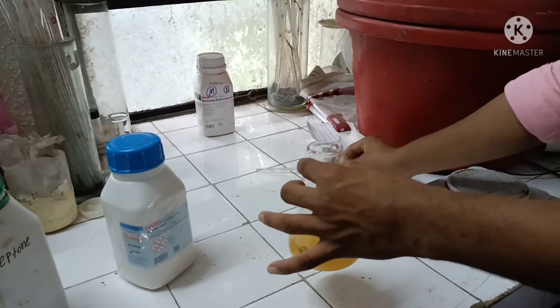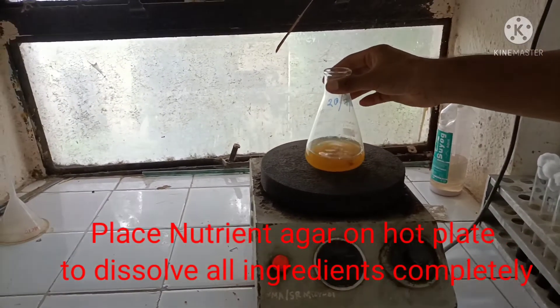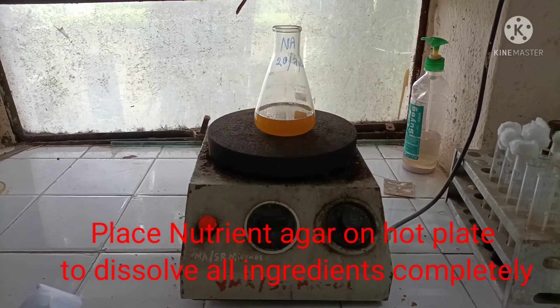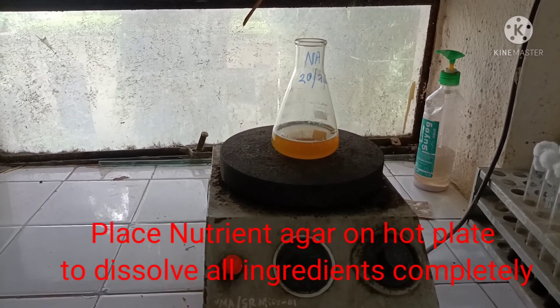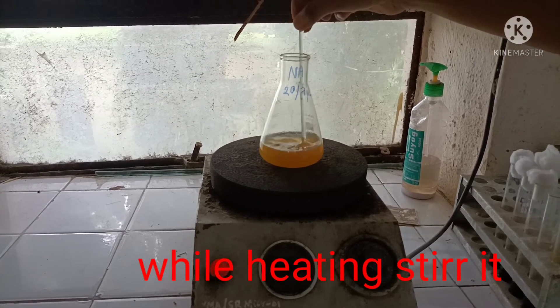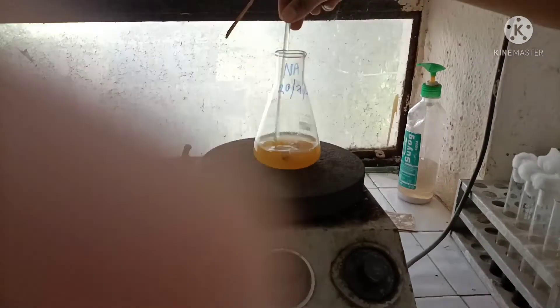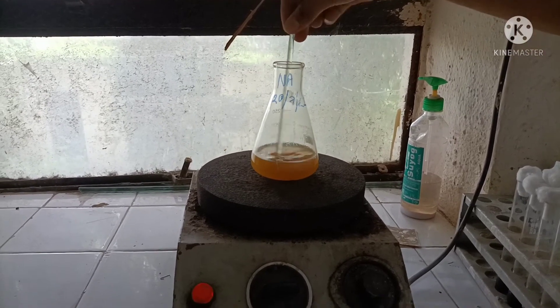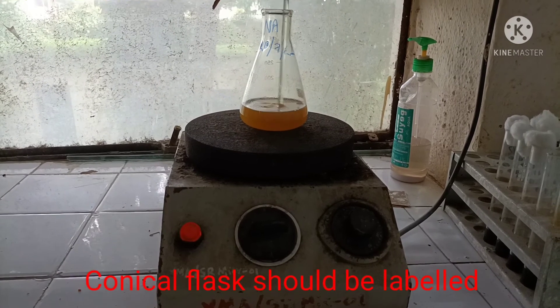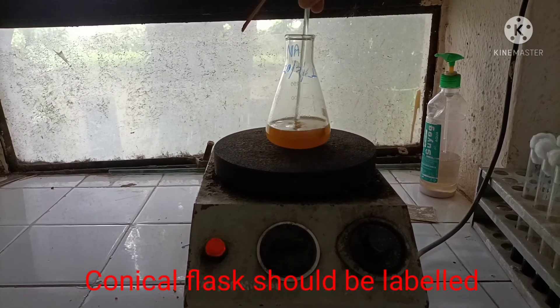Then we place the conical flask onto the hot plate for heating. While heating, we have to stir it so as to dissolve all the ingredients. We allow it to heat and boil for some time until all ingredients are dissolved. The conical flask is labeled with 'nutrient agar', the date, and your class name — labeling is very essential.